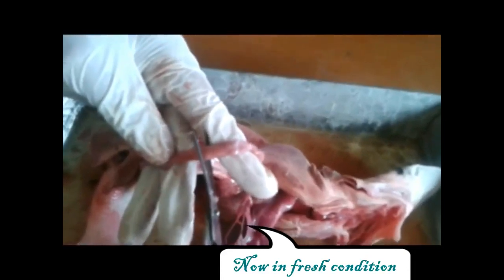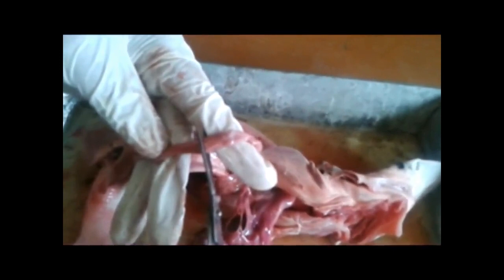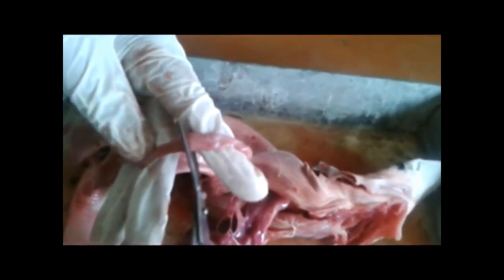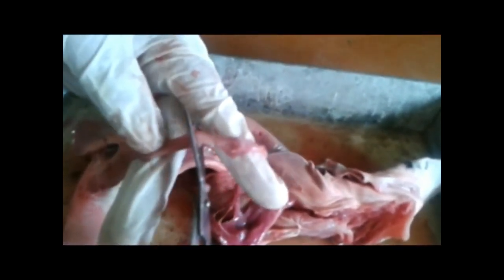So fold is there. Which part, sir? Here I am just taking a horizontal cut on the intestine. Oh, I should have cut it in a single shot. No, the scissor is not out.